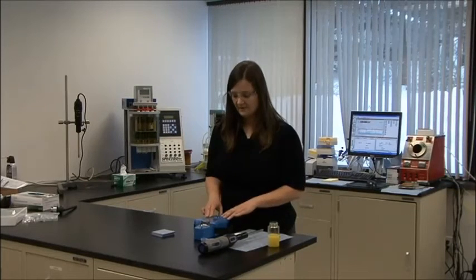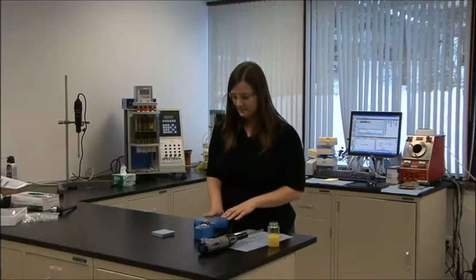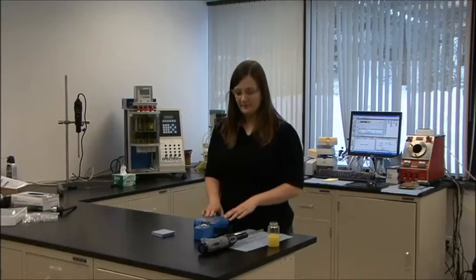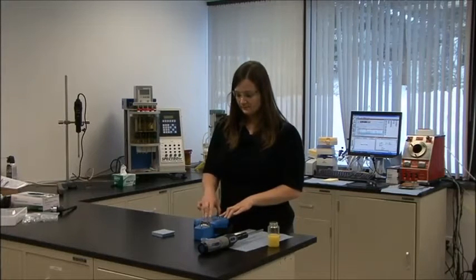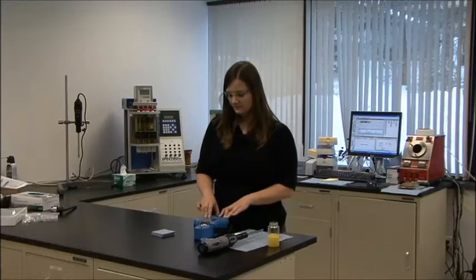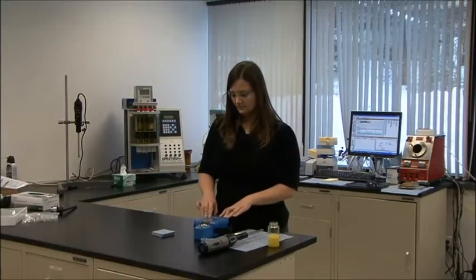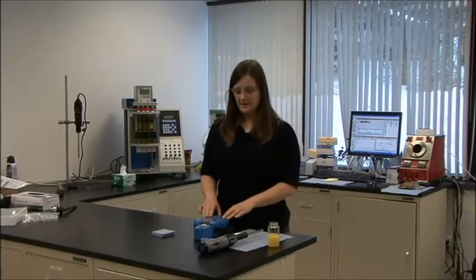So while I'm letting my sample rest, I can go through the menu screen on my FluidScan, choosing the appropriate category and the appropriate fluid, entering in a sample ID.